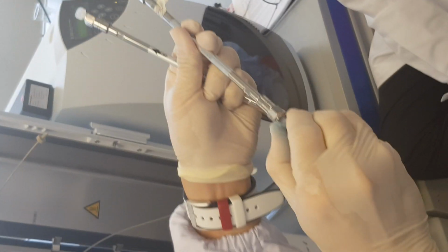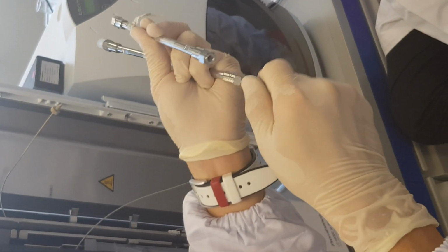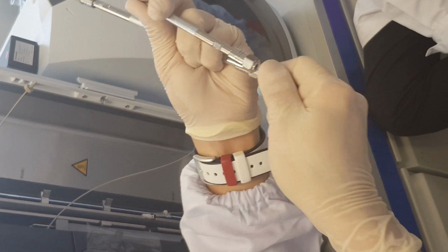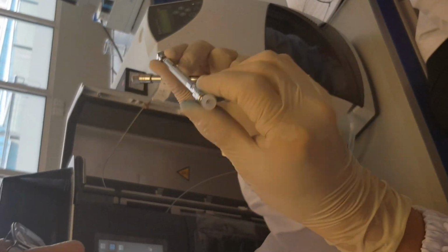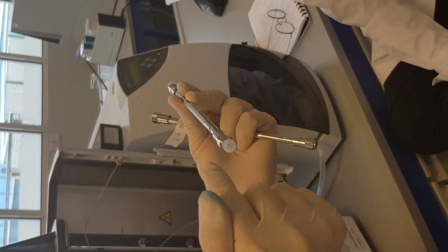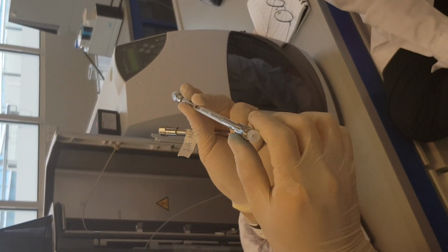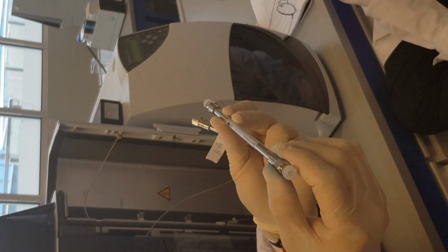Why do you want to ensure it to be stoppered? Nothing will leak out, but you want to make sure that the column inside here is moist. It's wet. If you open it, let the hole expose to the air, eventually this whole column will be dried over time.